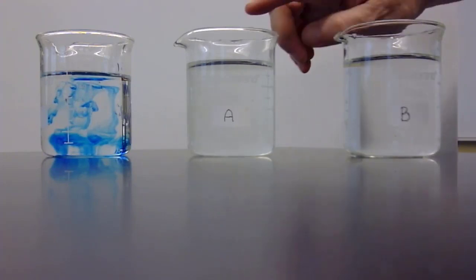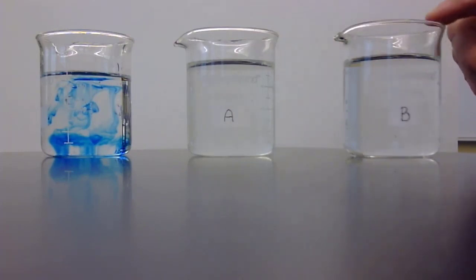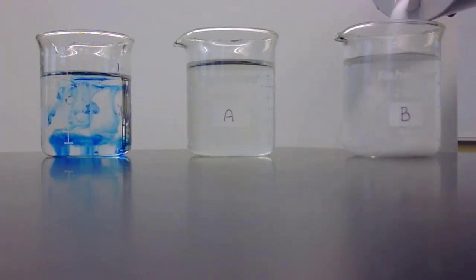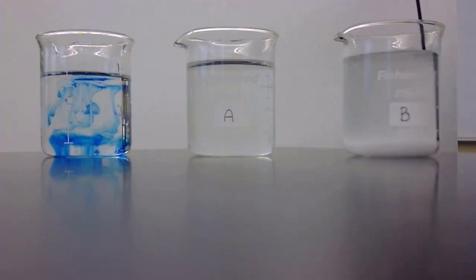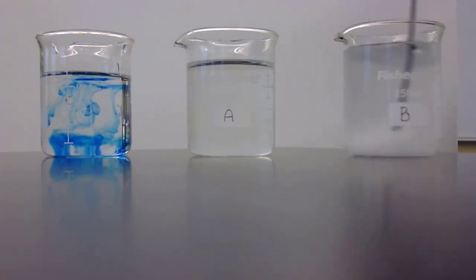And we're going to put one chunk in very plain water, and we're going to put the other in some very salty water. And I'm going to salt this water up right now. So it'll take a moment or two of stirring to get that to distribute.